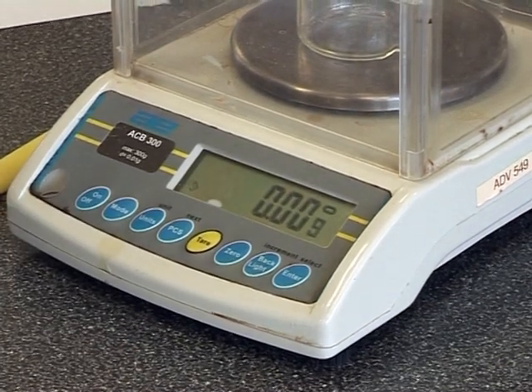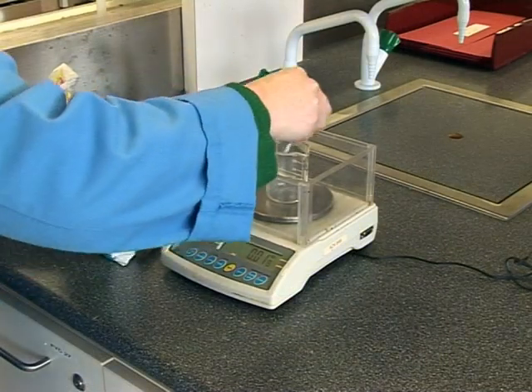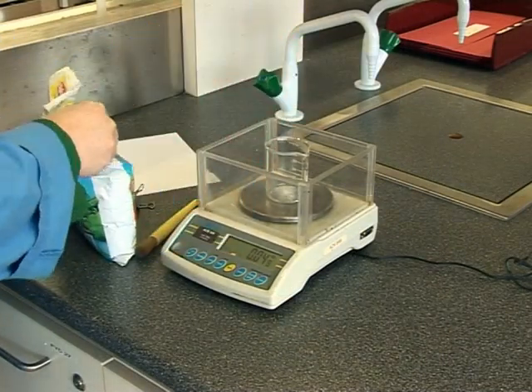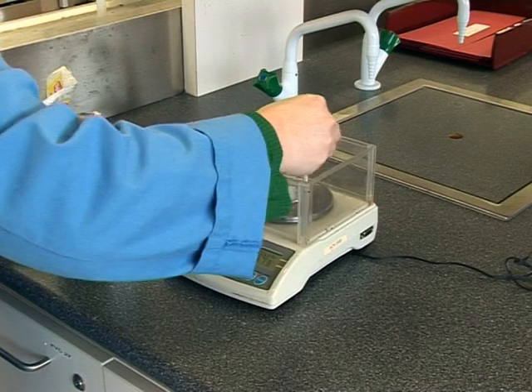Using a spoon or a spatula, dispense the analyte to be measured into the beaker a little at a time until the desired mass of analyte is achieved.